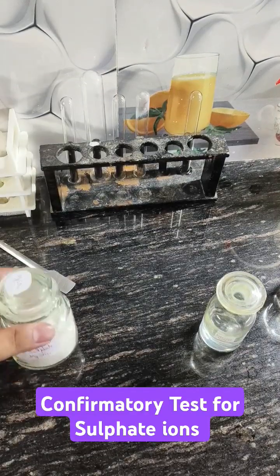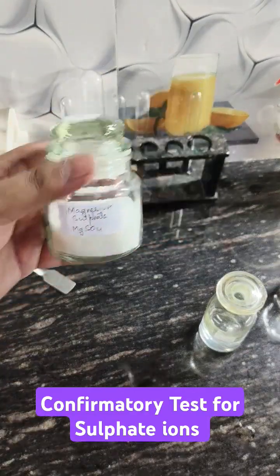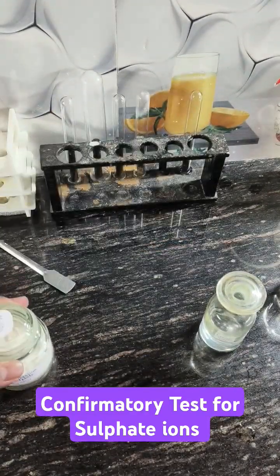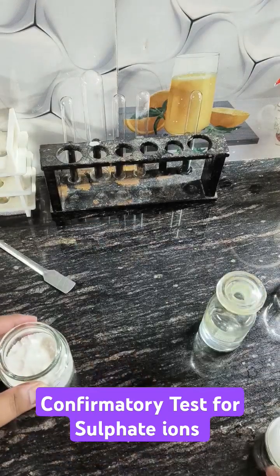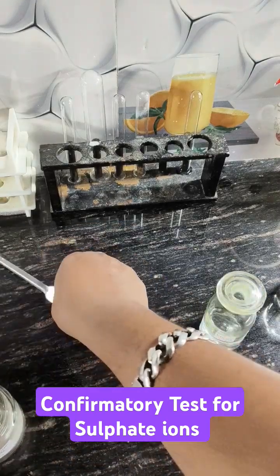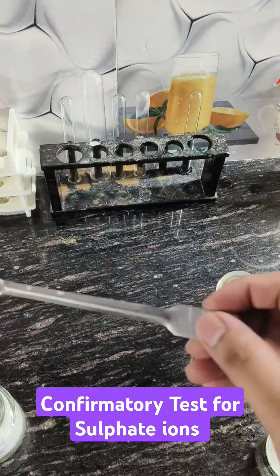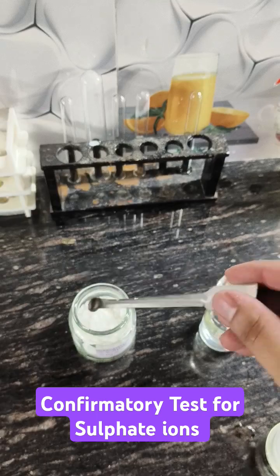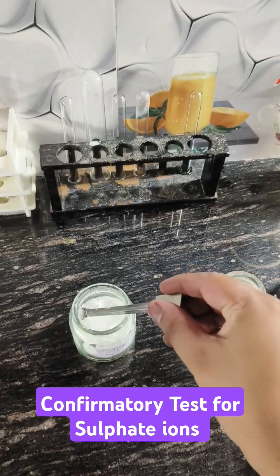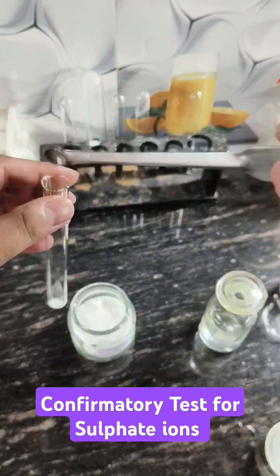Today we are doing the confirmatory test for the sulphate ions. I am taking magnesium sulphate and firstly I will prepare the original solution by dissolving a pinch of salt into 2-3 ml of distilled water in a clean test tube.